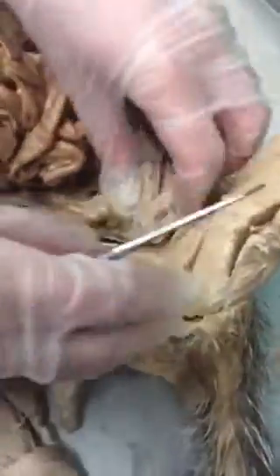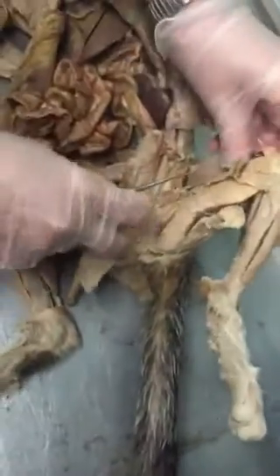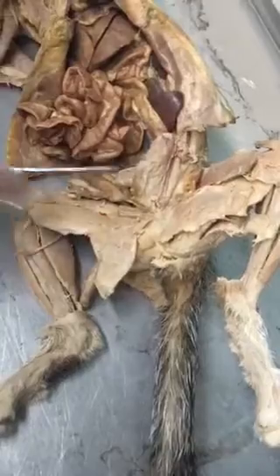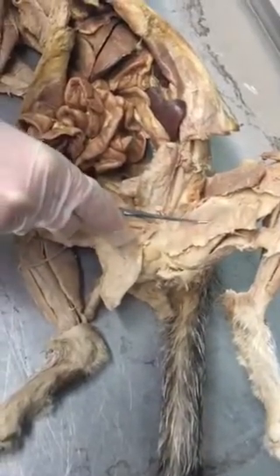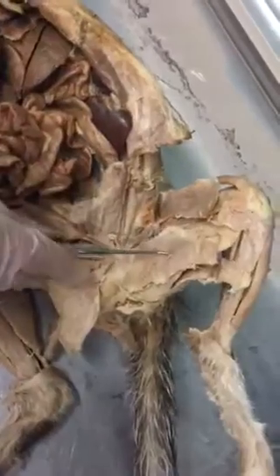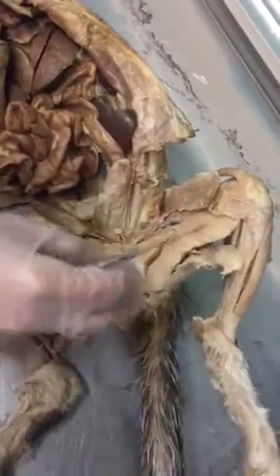Okay, then we come to the thigh. Let's see which one is better here. There are 2 superficial muscles on the thigh. The one on the inner thigh is the gracilis, and the one on the outer part of the thigh is the sartorius. Gracilis, sartorius. If you lift the gracilis, you first have... it's not that good here, it got chopped up.